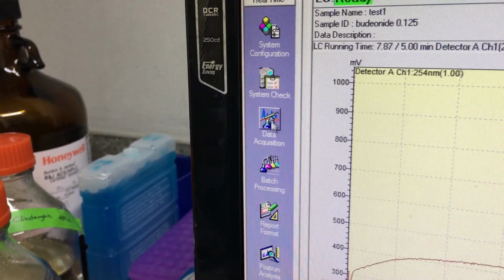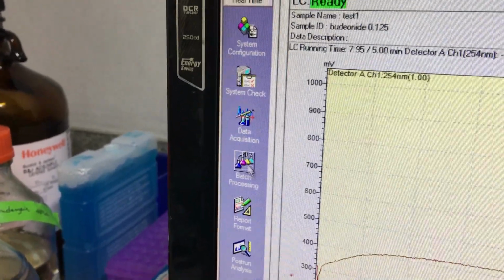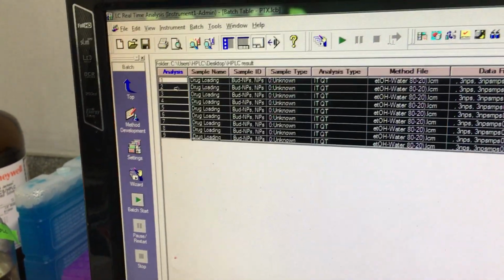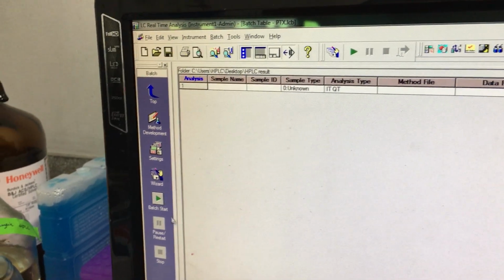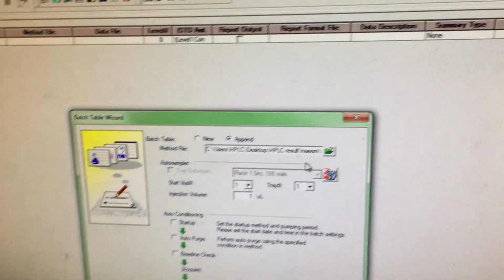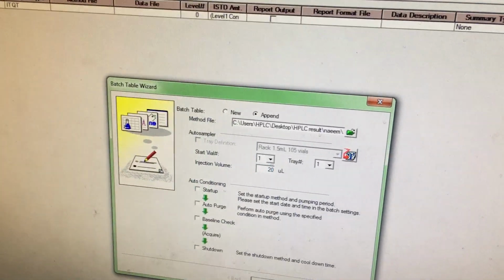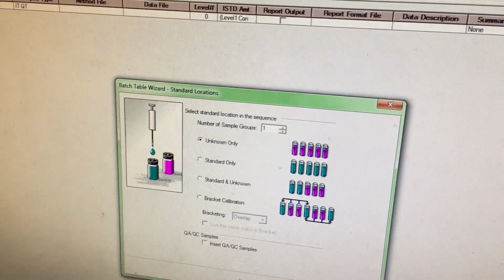We can go from here to multi data acquisition, the batch processing. That was single, but here is called batch processing. So the old one you will delete or clear, delete row, and then you click wizard. See wizard, and whatever your method is, okay. How many microliters of standard you use, 20, so here you will also use 20. And then next, and then there are two methods, standard and unknown, but usually we use the unknown method.